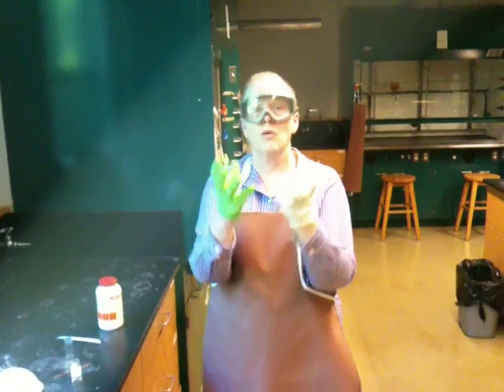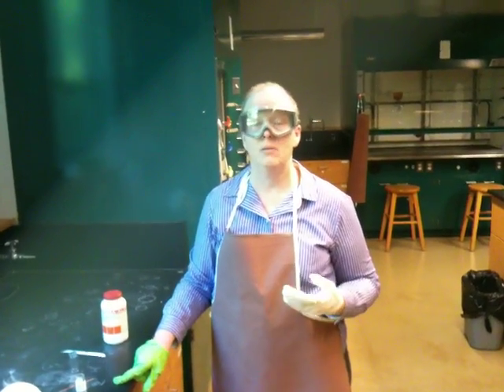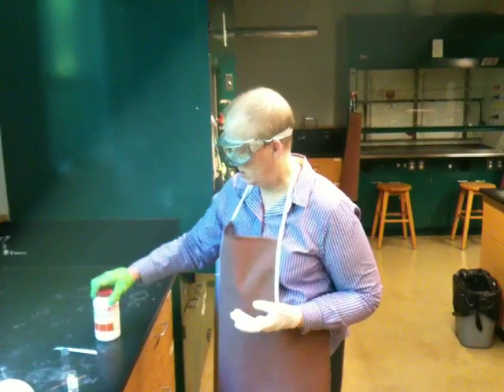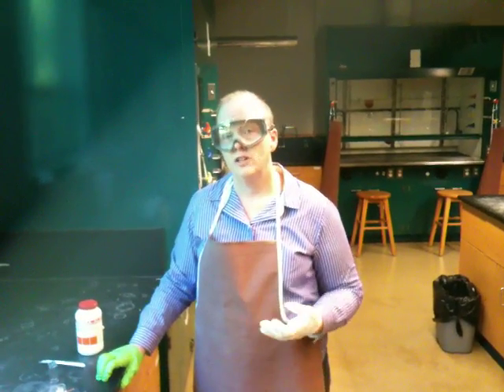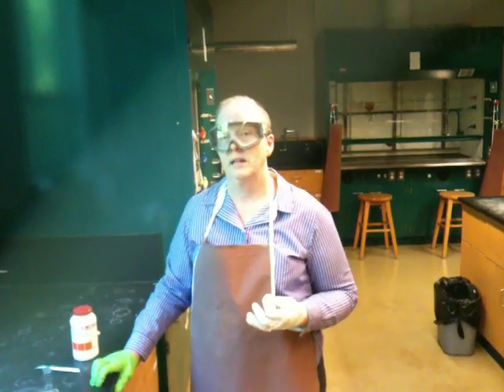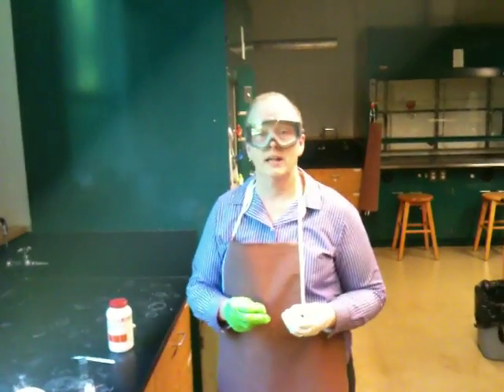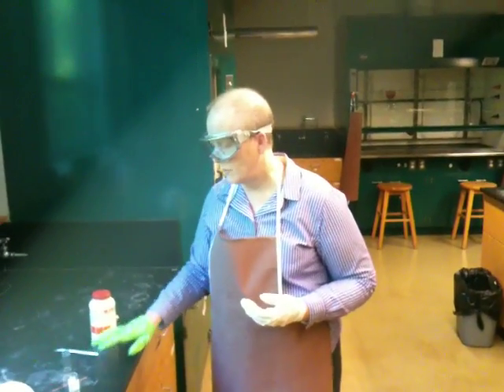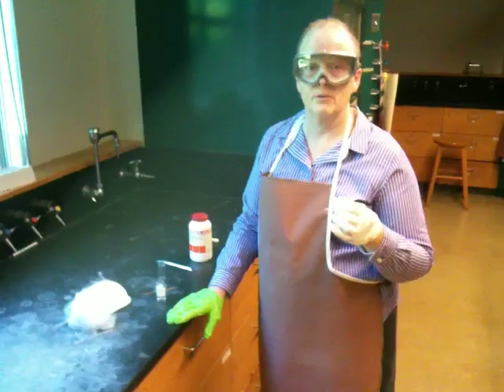And the drying agent absorbs the water molecules that are contaminating your sample, because as organic chemists we do not want H2O in our samples. Okay? So the problem with that is that when you filter, and you might be able to imagine this by now, you lose a lot of your compound on the filter paper and on the drying agent. So sometimes we use a technique that's a little more complicated to set up, but it gives you better results.